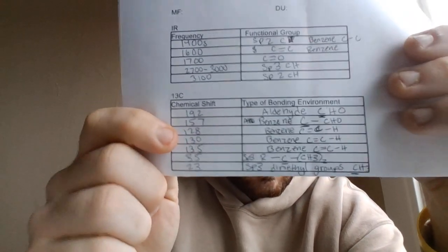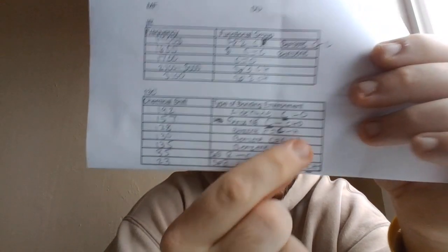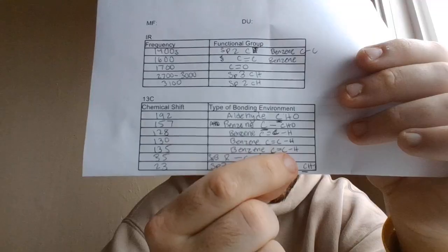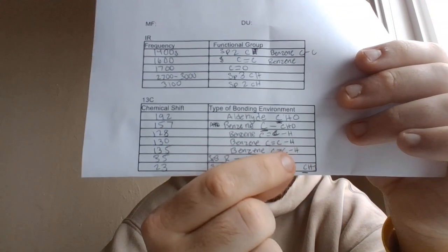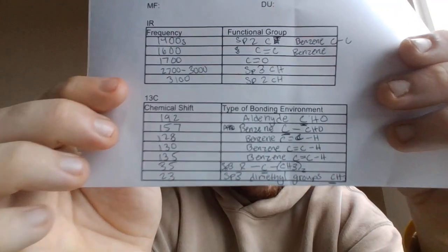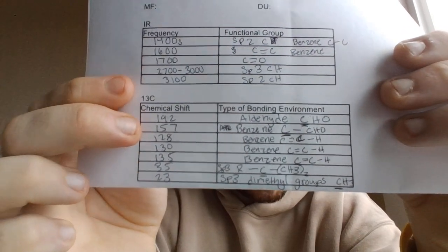resonance. And then we have three inputs here for the benzene ring carbons. I didn't underline them because you can count it as the sp2 carbon that is attached to the hydrogen, or you can call it the sp2 carbon that is double bonded to the other carbon. So you can read those as either of the carbons in the benzene ring, depending on the resonance at the time.